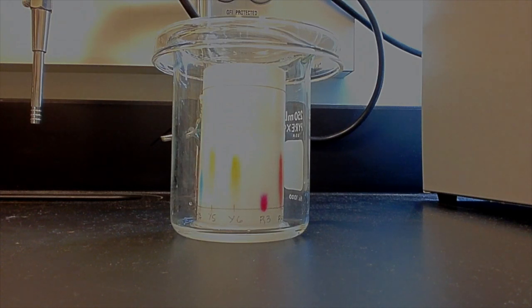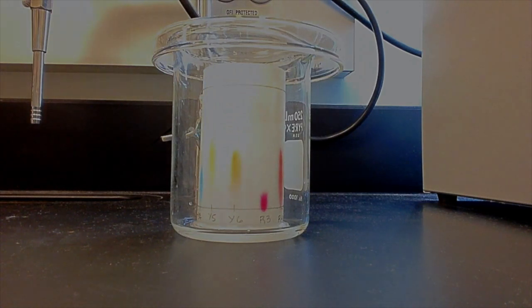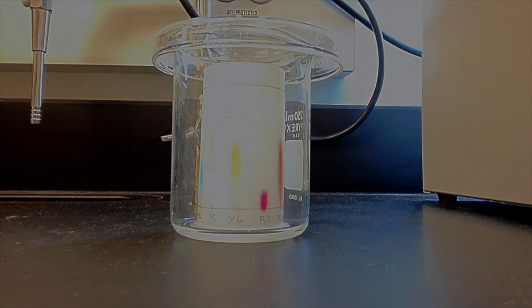Once this happens, remove the paper from the beaker, unstaple it, and allow for it to dry on a paper towel. Your solvent will run up over the top margin. Draw a line where this ends. This is your solvent front. Make sure to do this before your paper has completely dried.